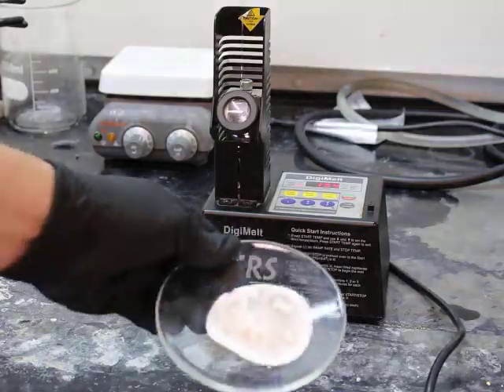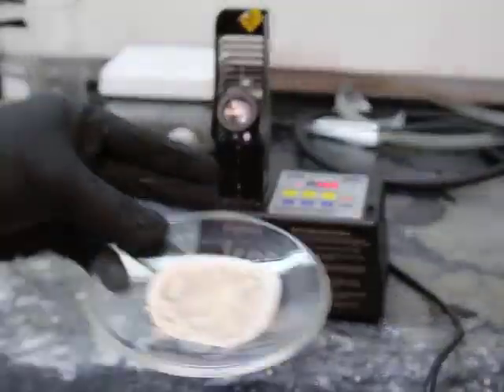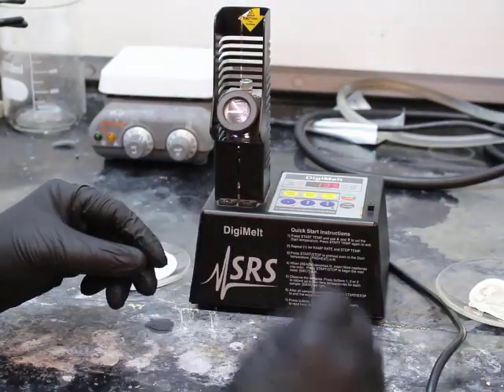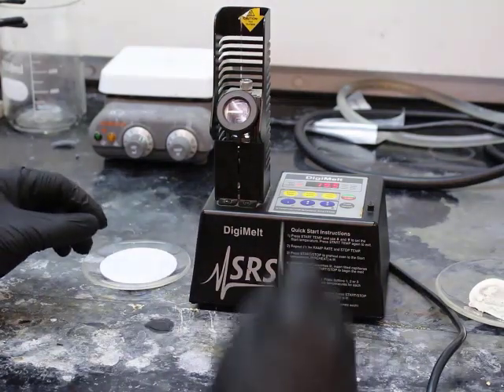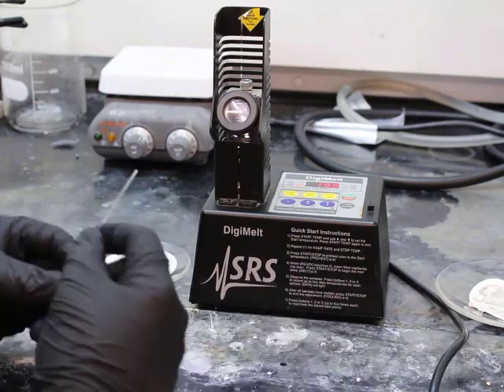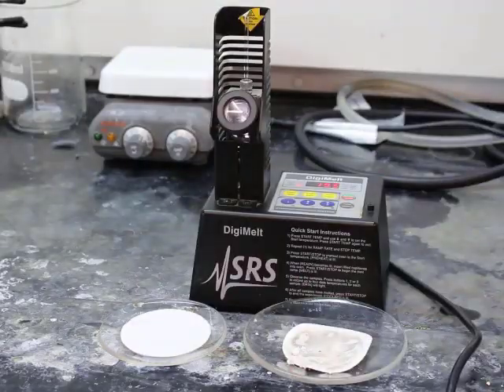What you saw is using the capillary tube, trying to get some of those solids in the capillary tube, tapping the capillary tube to get some of that solid at the bottom. And so we have each one of our extracts in 2 different capillary tubes.